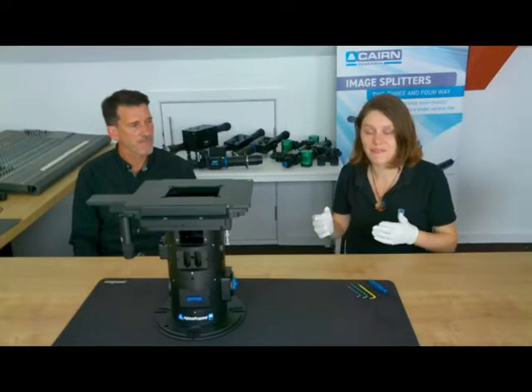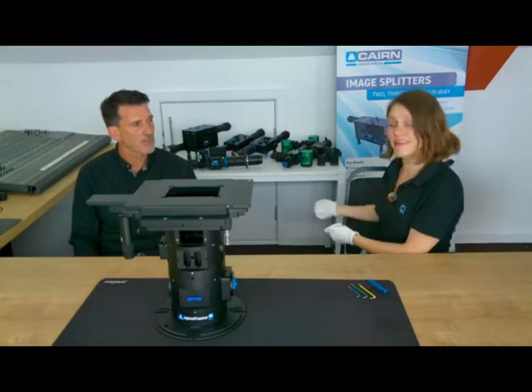Hello again. Now we're going to just run through a couple of different configurations with our range of image splitters and light sources. Off we go.